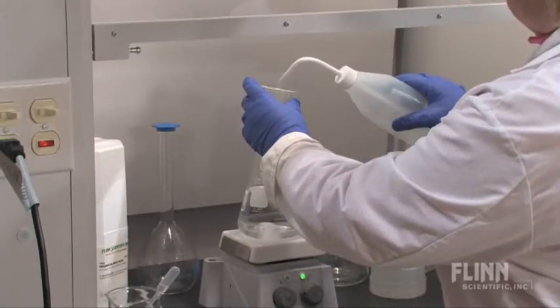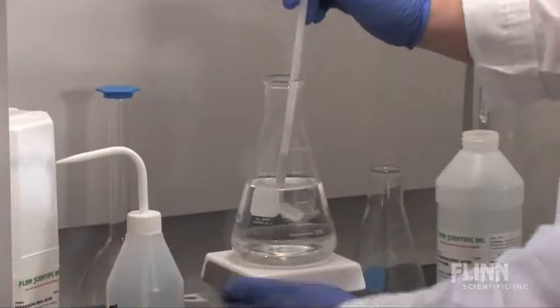Then dilute to the final desired volume. Don't forget to label your solution.